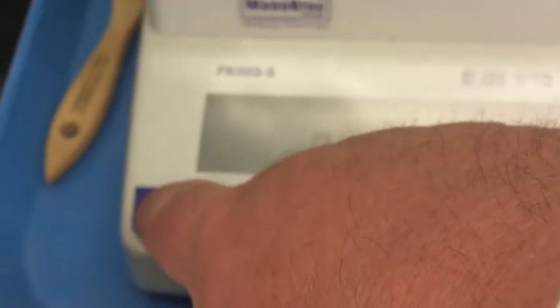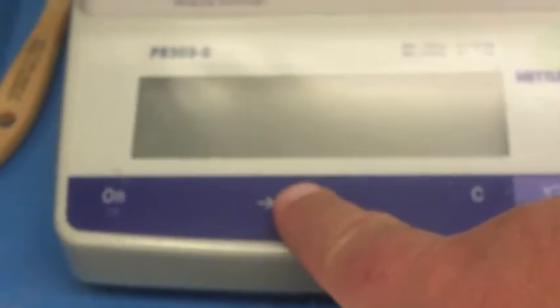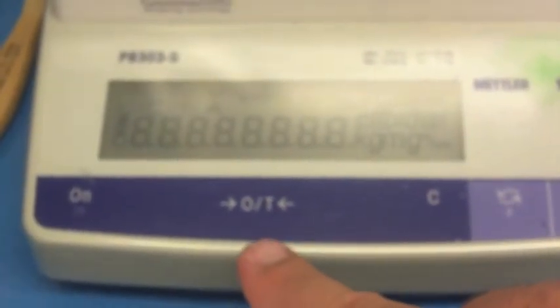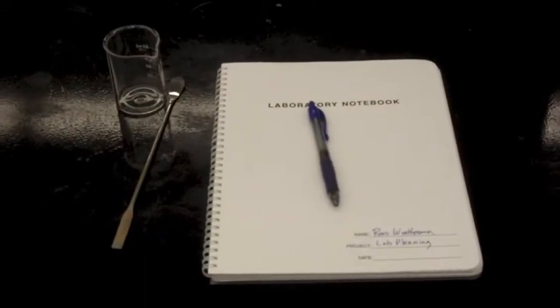The tare button is also the on button, so there's an on-off that allows you to turn it on and off. It should be on, and you should be able to press the tare, which will set it to zero with whatever is on there.